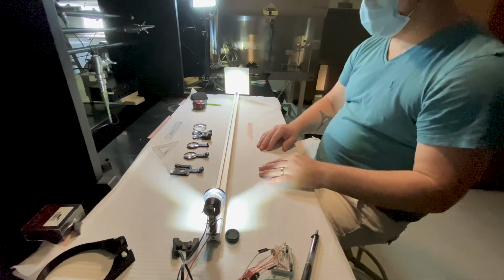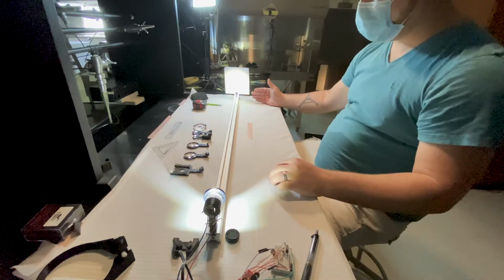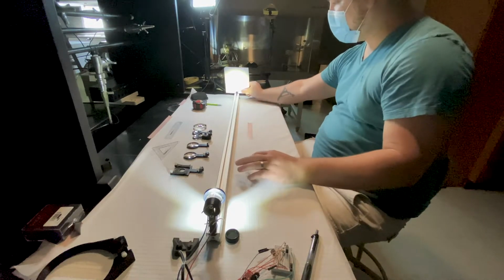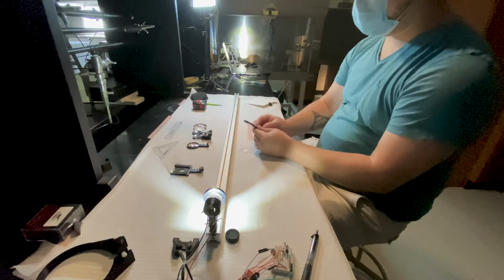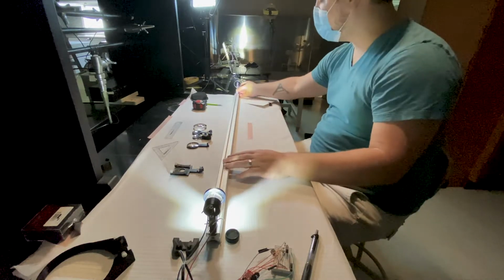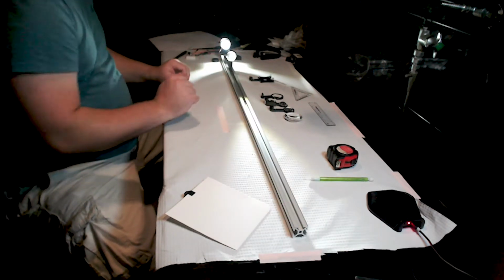So now we have our light source, and we have a way to look at an image plane. Now what we need is a sample and some sort of a lens that we will be using to form an image of that sample. So I'm just going to take this screen off so that we can pick a lens, and I'm just going to choose the 4x tube lens. Now everybody remembers that that lens had a focal length of 70 millimeters. Right, and we're just going to put this guy somewhere over here for right now.